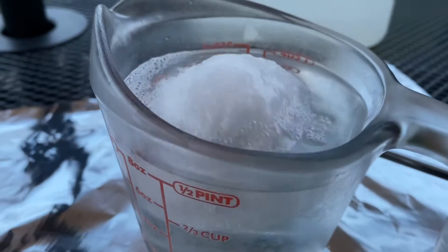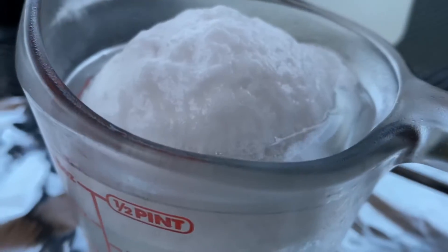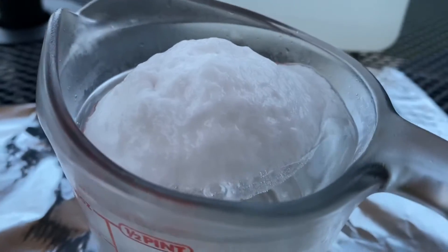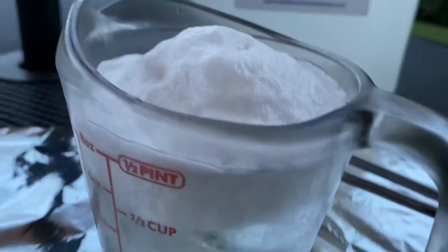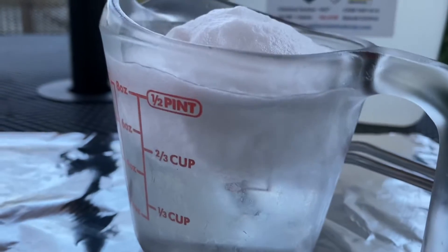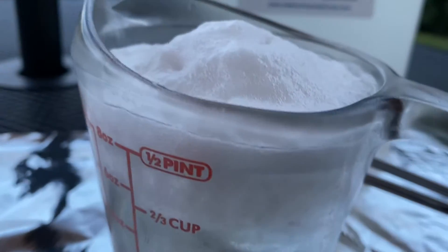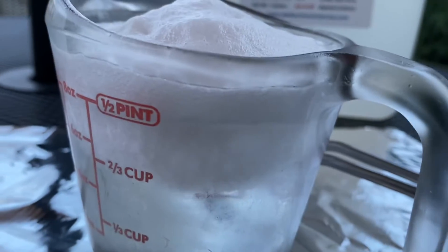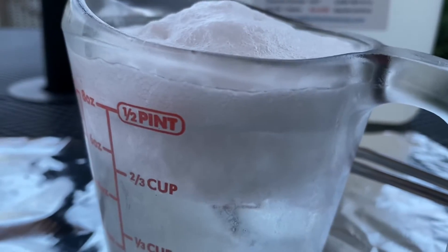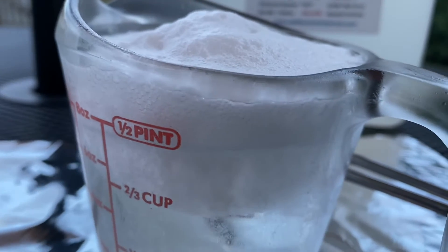Right away, notice the egg doesn't sink. It floats. And the effervescence of all of that CO2 is amazing as bubbles form on the outside of the eggshell. Remember that an eggshell is made out of calcium carbonate.